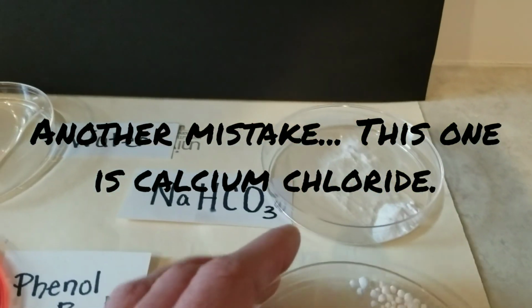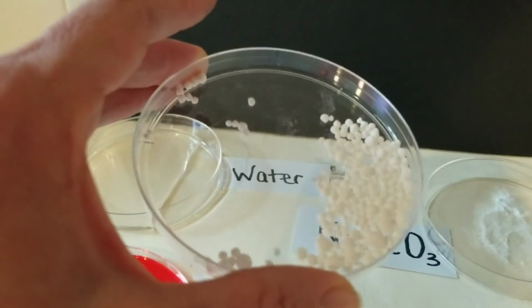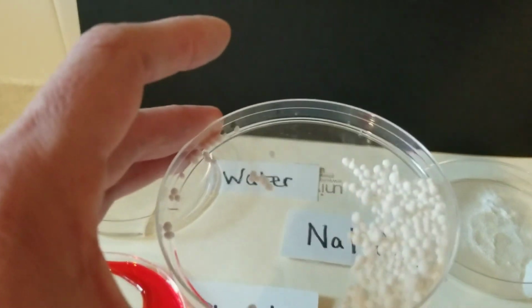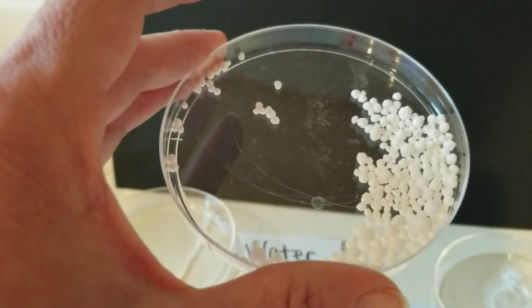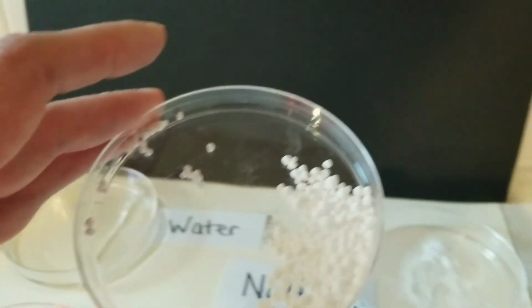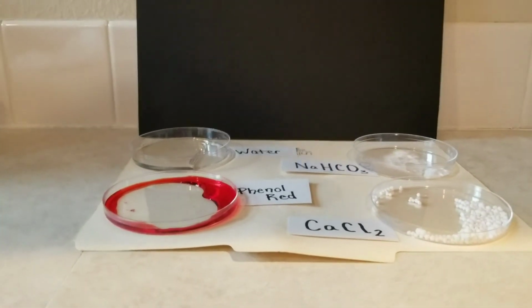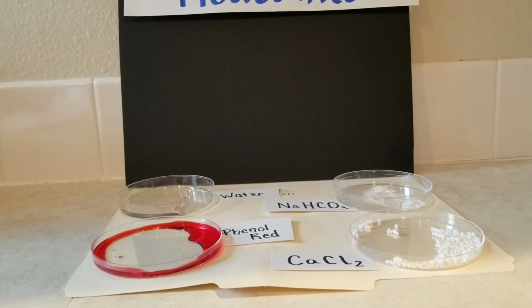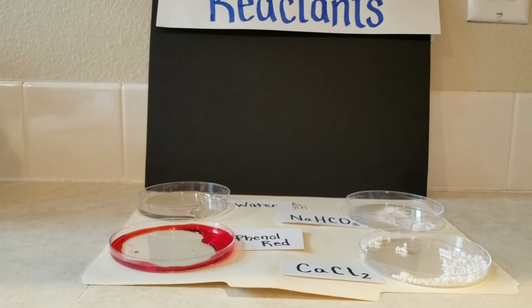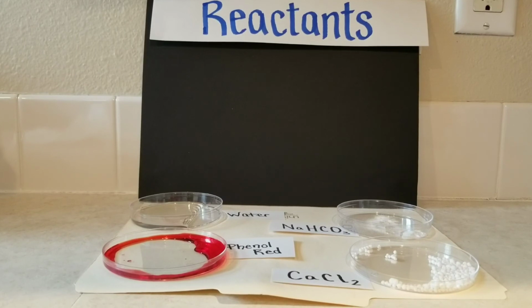The calcium chloride, when we look at it, literally just rolls around in the container when we move it. So a different texture to it. It doesn't leave the coating on the base of the tray like the other one does. So those are the reactants that we're going to start with, and then we'll make observations of what happens, what changes take place when we combine them together in different arrangements.